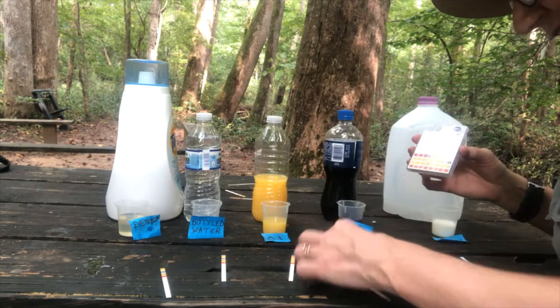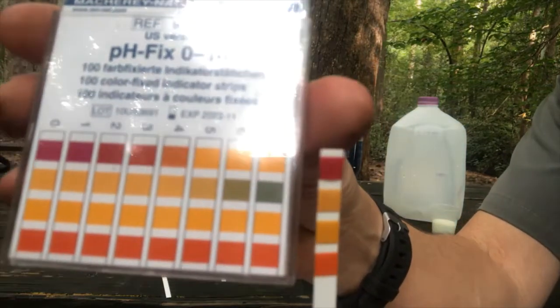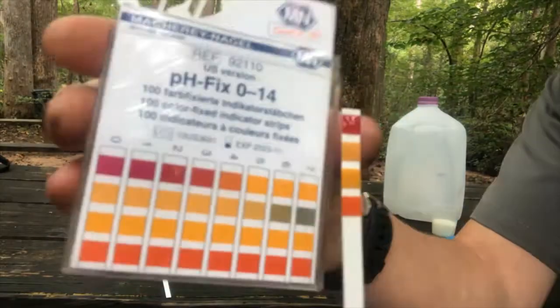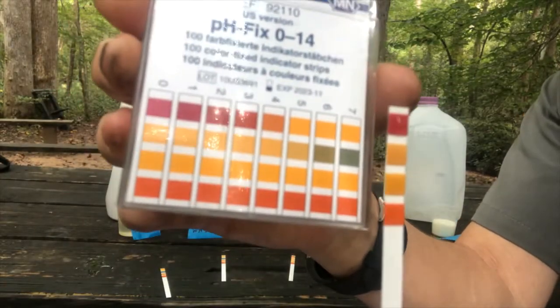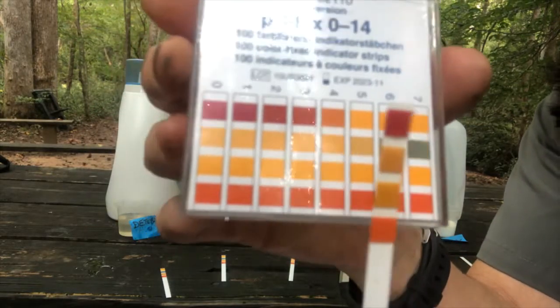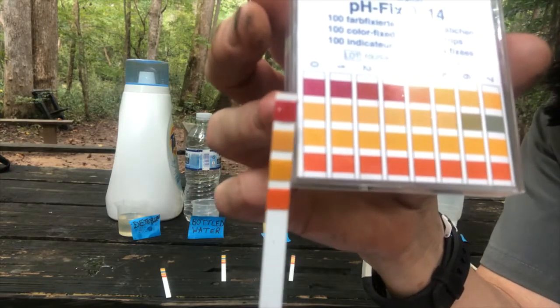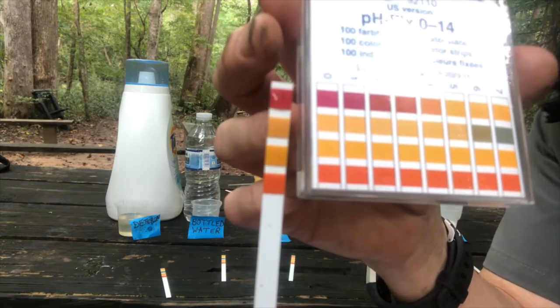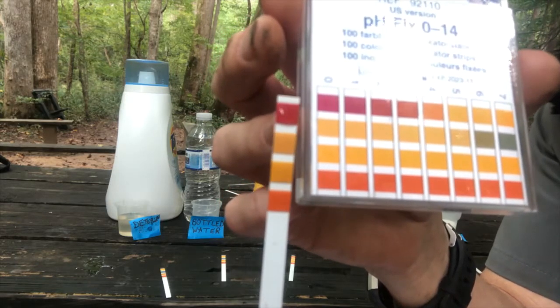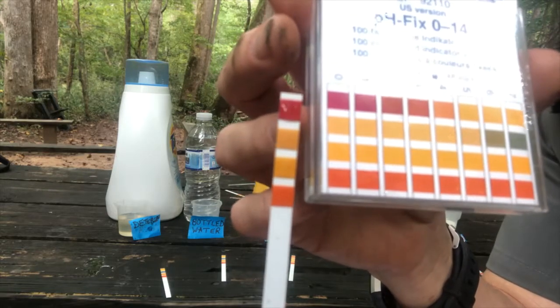All right, soft drink. Let's look at this strip here. Okay, this is interesting. We see no green, so we're working with 0 to 7, and we're actually seeing a sort of pinkish purple color that we hadn't seen in the others. So let's take a look here. We're talking about one of the low pH numbers, very acidic numbers. Is it 0, 1, 2? You determine, maybe looking mostly at that pinkish purple and then looking at the other colors too.